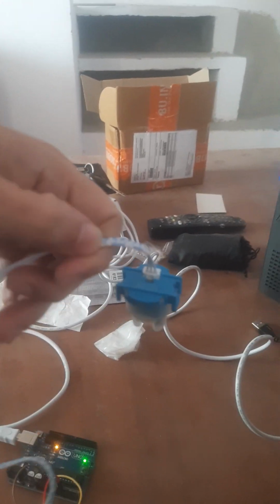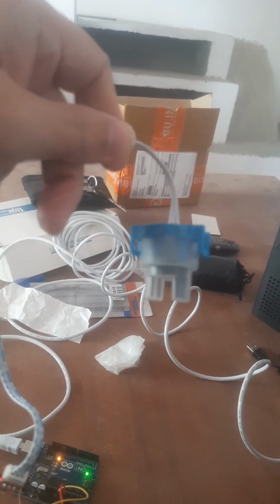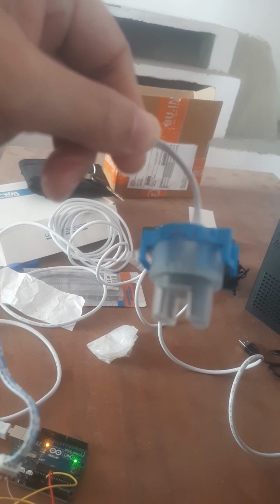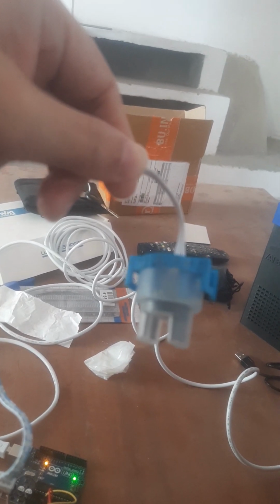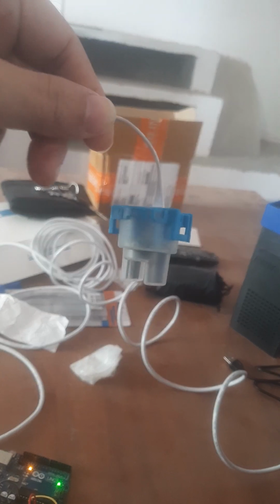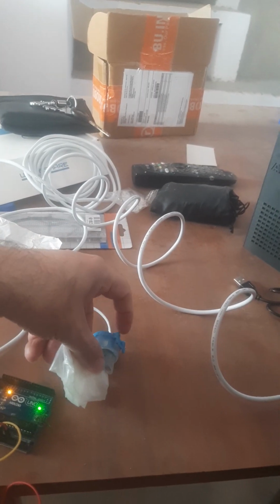We are now going to talk about another electronics device called a turbidity sensor. It can be used as an optical density proxy as well, which means that this will tell the turbidity in the liquid that is between the two joints, which is this one.